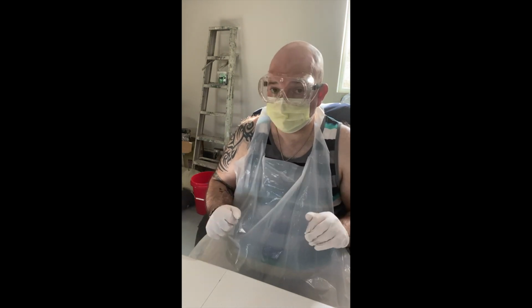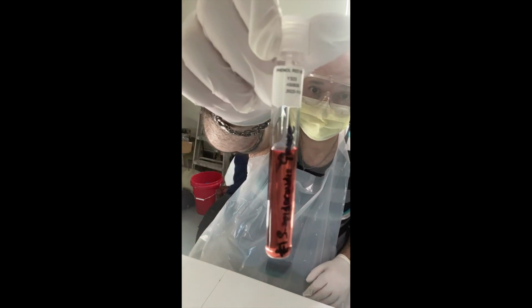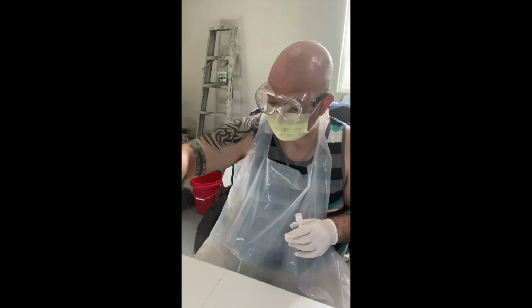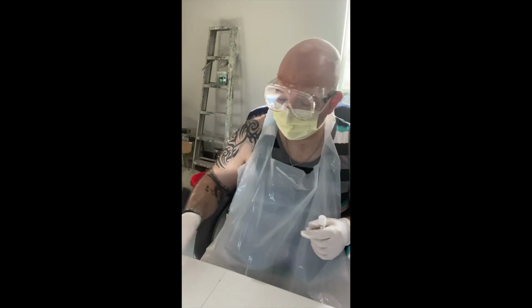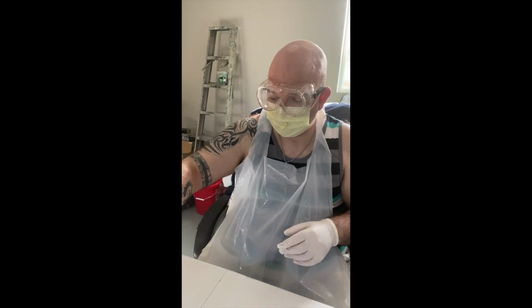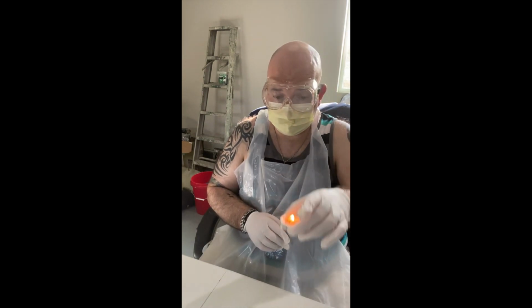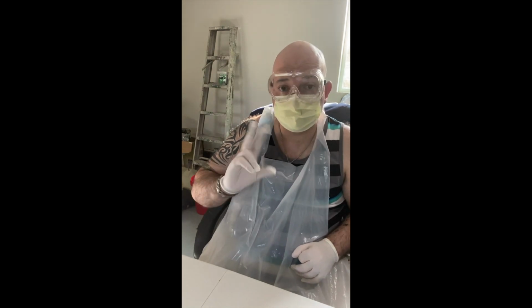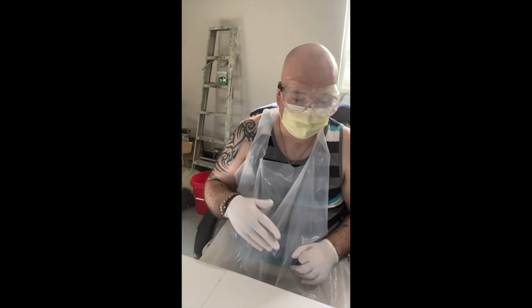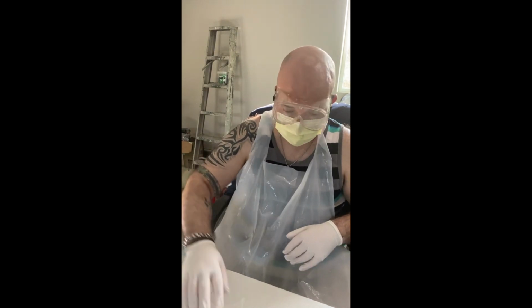So I'm going to start with adding the glucose. Again, I have my S. epidermidis glucose, S. cerevisiae glucose, and then I have my glucose powder. What I'm going to do is flame each of the tubes using my tea light. I will then pour half of the powder in each tube and then mix them. And then I'll do that also for the 2 tubes for the fructose and the 2 tubes for the mannitol.